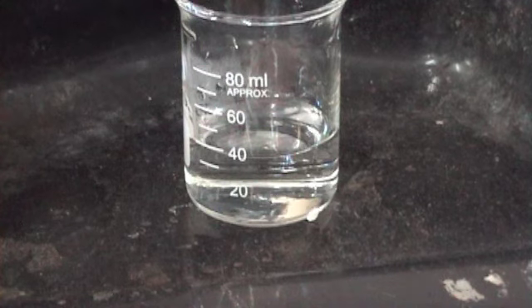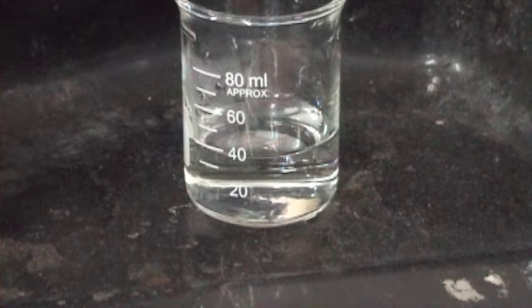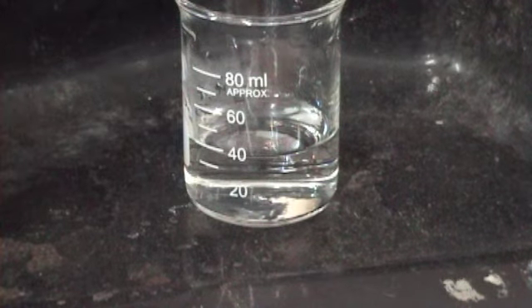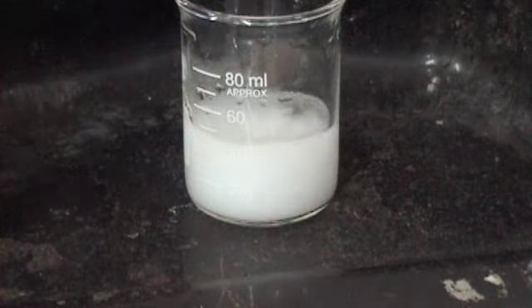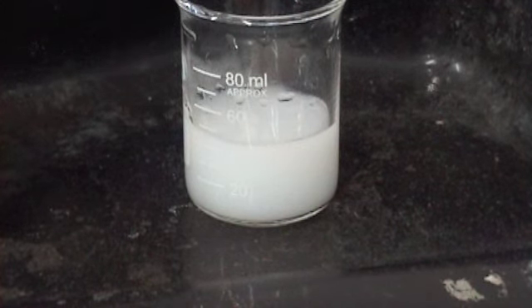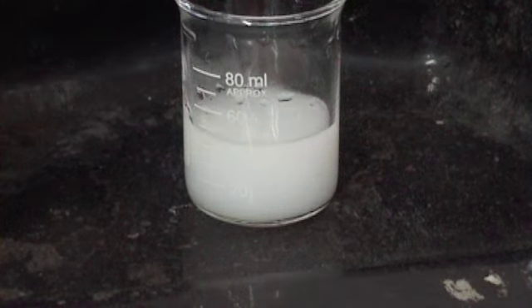All right, so that shows us that it's not. Stop. Make sure your brain's engaged in gear before opening mouth. We're testing for anions. Yes, it's not hydroxide and it's not carbonate, all right? Our next test is to add name barium nitrate. What do you expect to see? And of course we do, because that is a white precipitate of barium sulfate. All right?